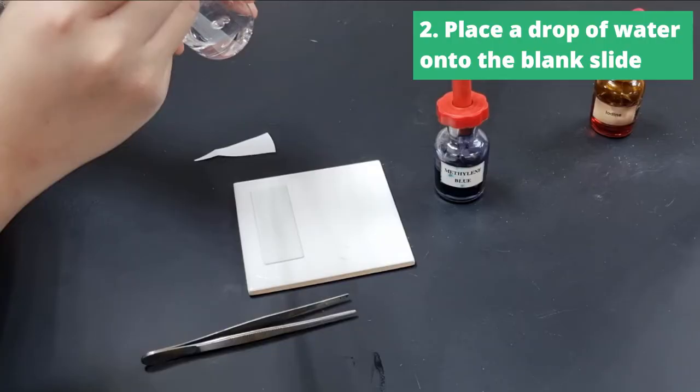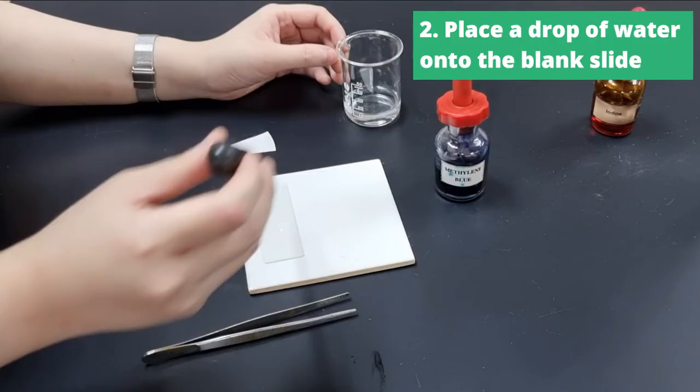Next we're going to take a drop of water and put it on a blank slide. So just a little drop right there on a blank slide. Not too much, just a drop.